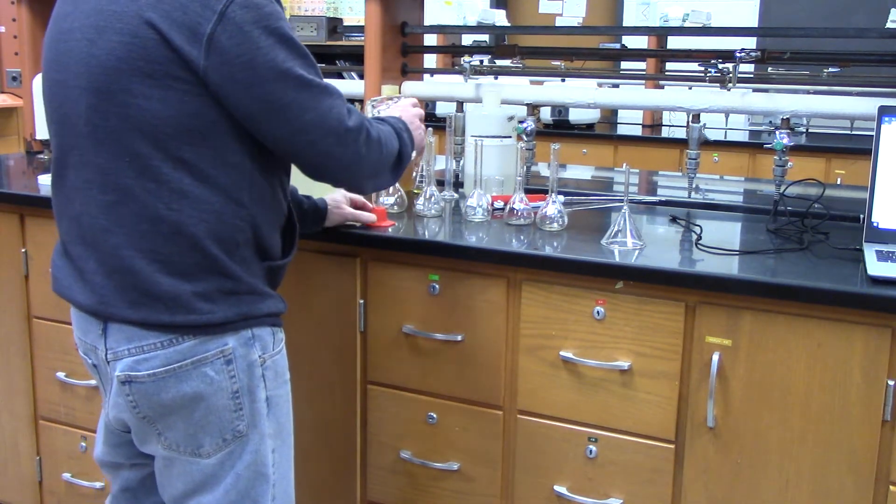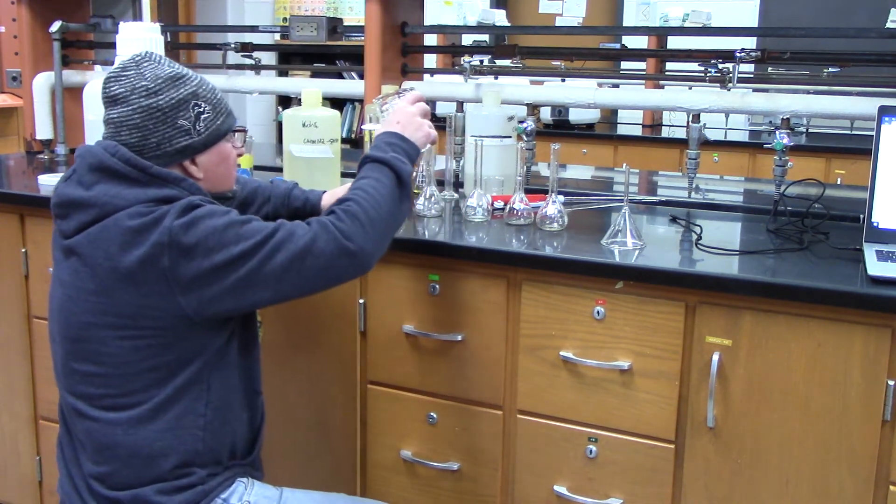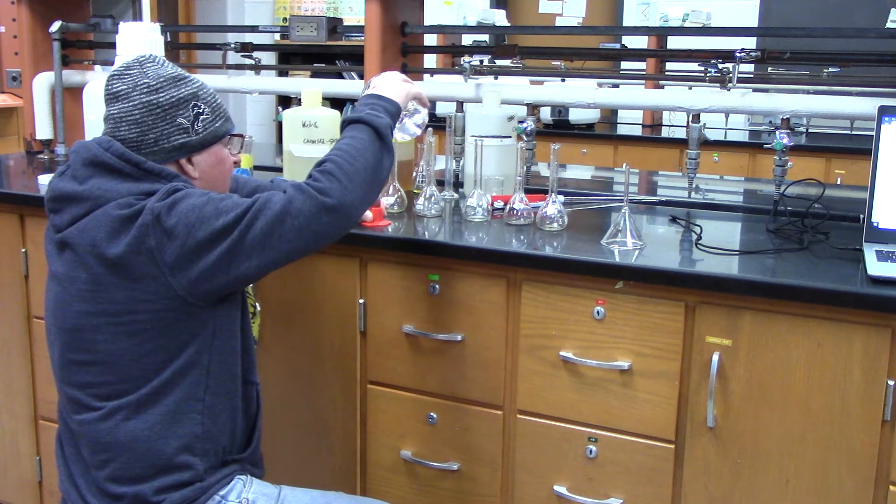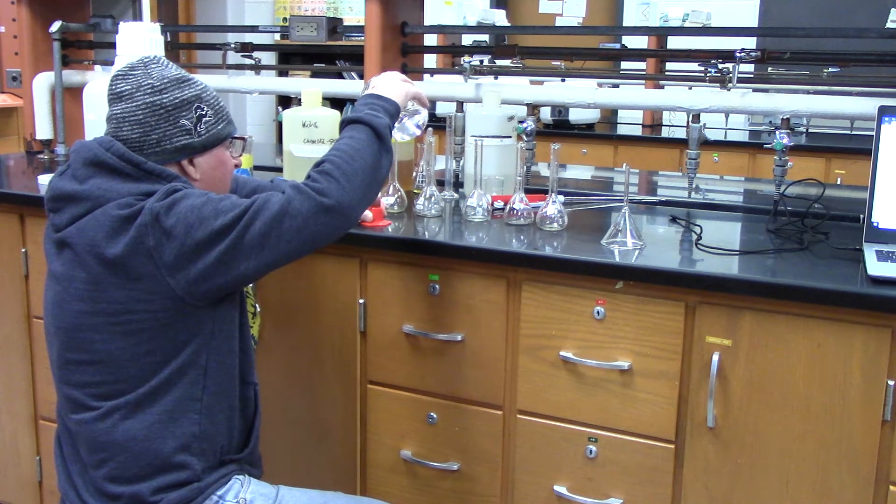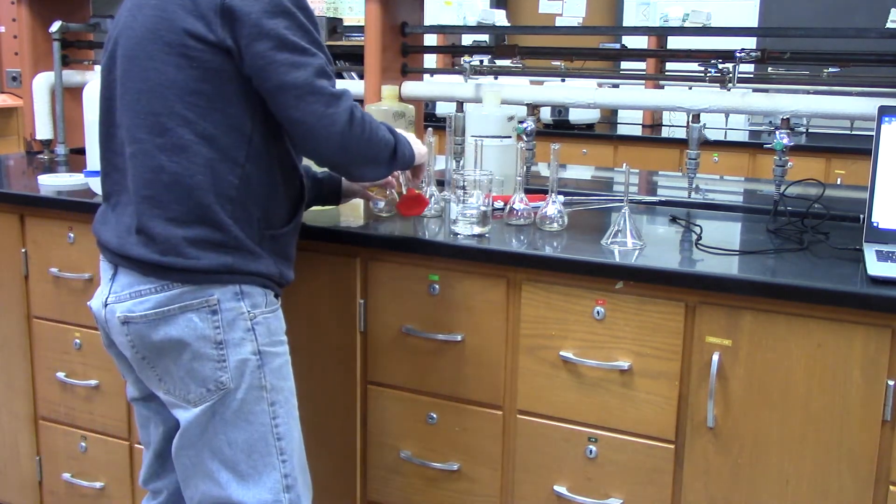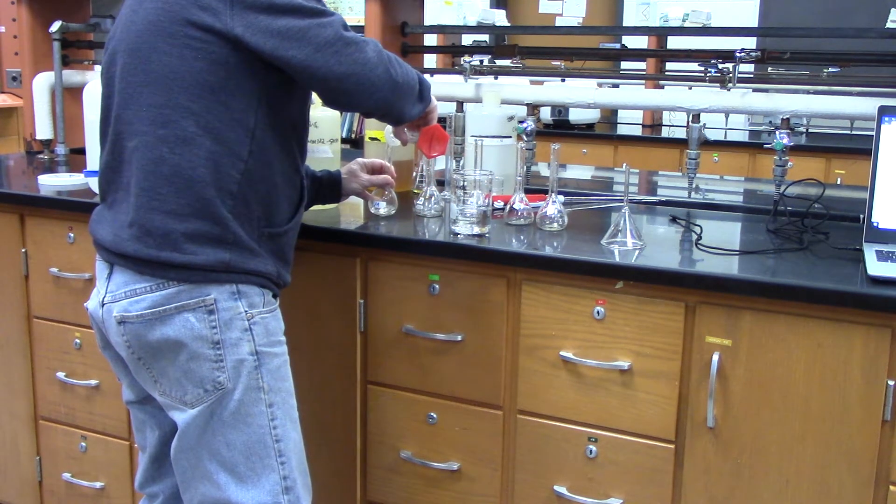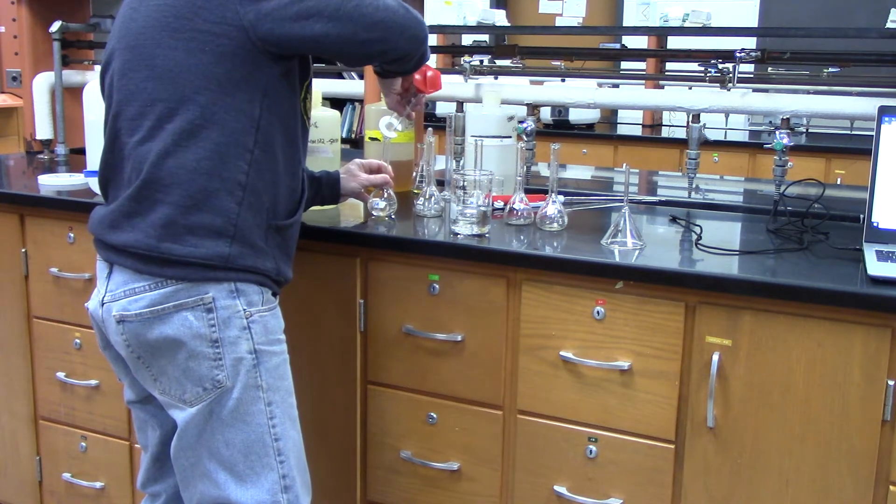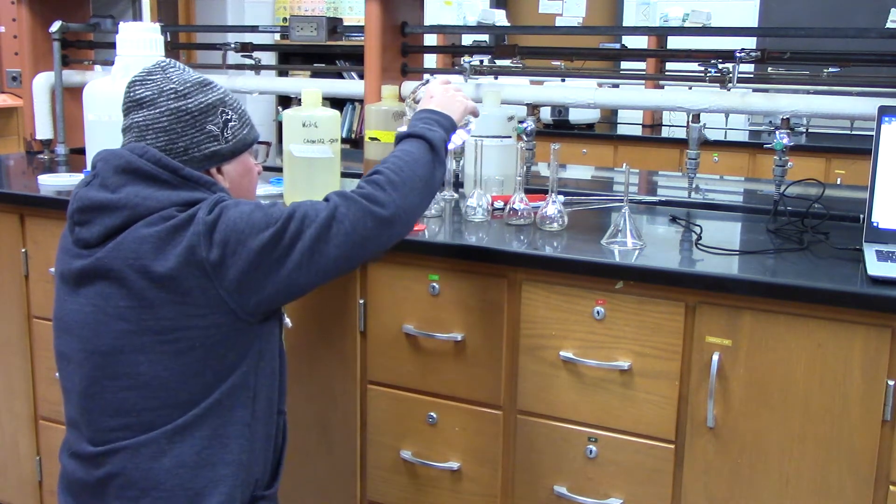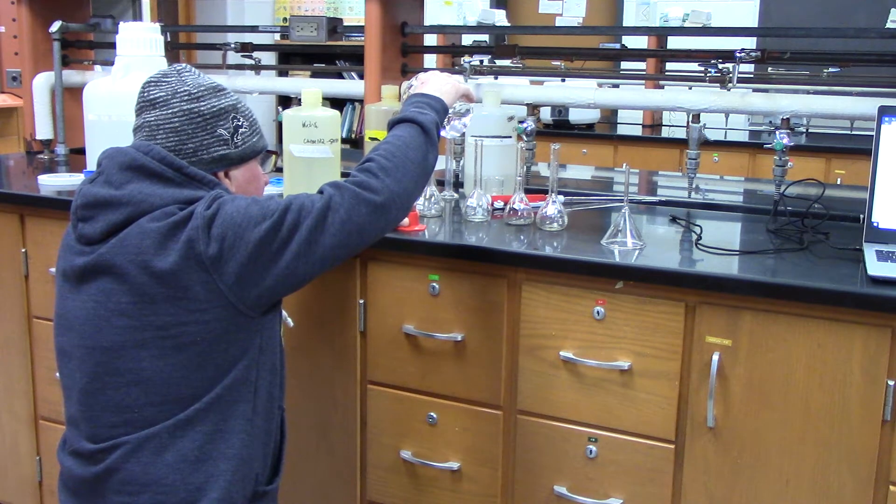And if you don't know, we're not going to worry about what's happening, we're just going to do the experiment. So I'm going to put 50 mL iron nitrate into each one.